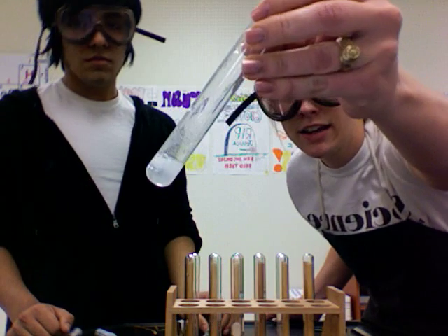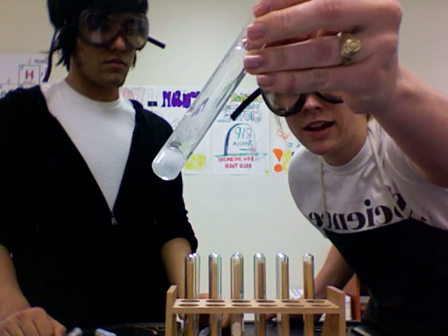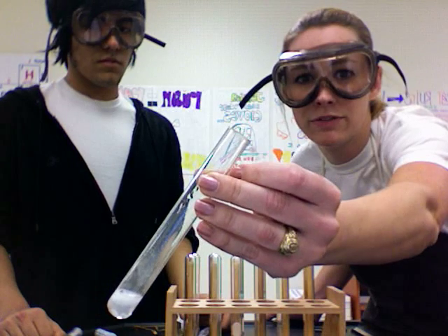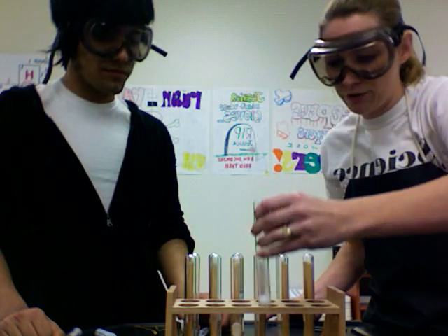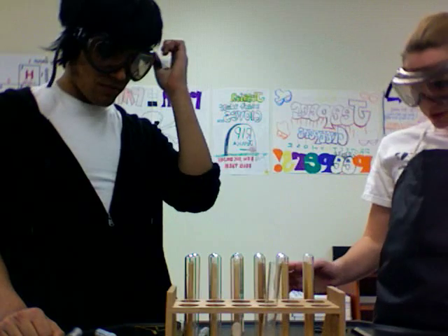And you can see it's bubbling nicely and you can see maybe a little bit of stuff — I don't know if you can see that or not — coming out the top of the test tube. We're going to let this reaction go for just a bit and let the test tube fill up with some hydrogen.